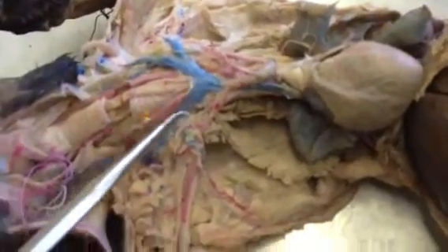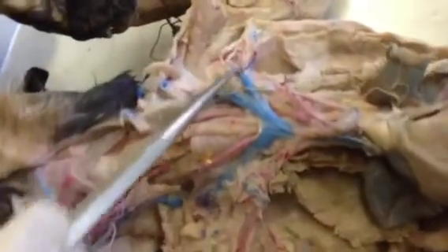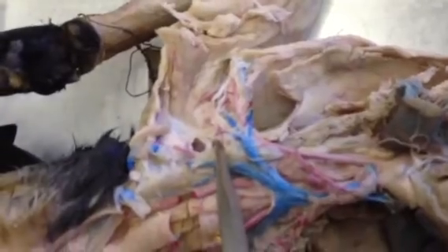The brachiocephalic vein is going to be right here. Brachiocephalic vein right here, this big one right next to the brachiocephalic artery. Then there's the right and left brachiocephalic veins. This is the subclavian vein, axillary vein. The axillary vein is going to extend into the brachial vein. You can't see it. And then the subscapular vein again will accompany the subscapular artery.